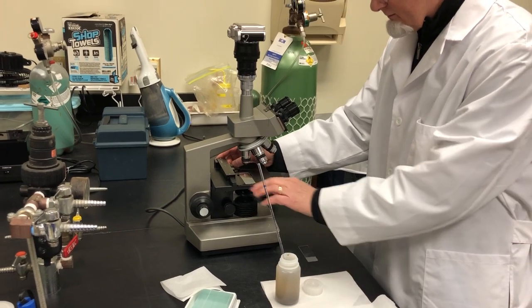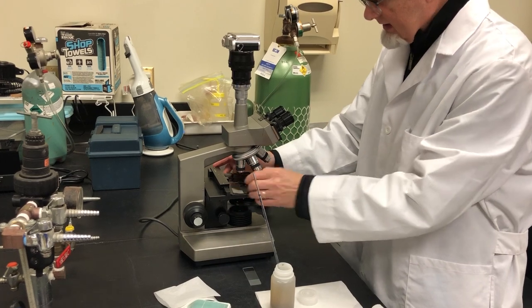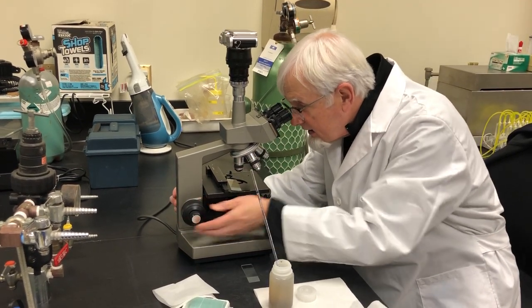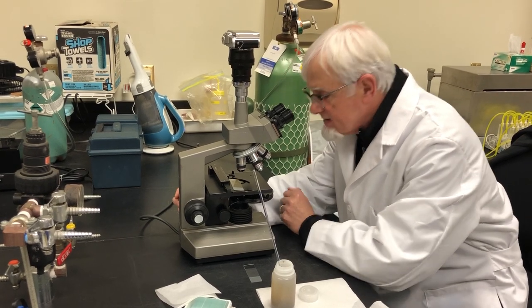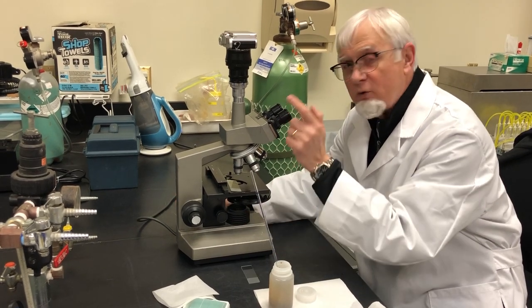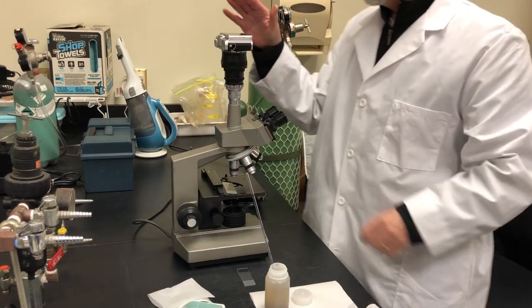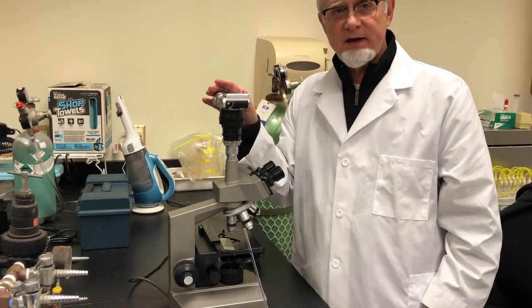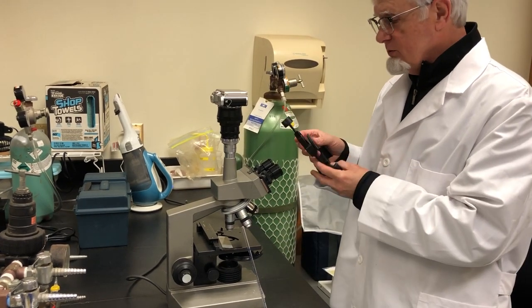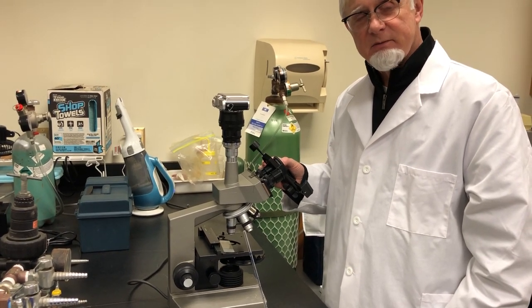Now what I'll do is I'll take that and put it under the microscope and go to 10x. I will view down there until I see some filaments and then I will switch my objective lens to 40x. This will give me a 400x magnification. I'll refocus, and if you have an electronic image capturing device you can capture your image from there, or you can use the cell phone adapter and attach it to your ocular here and capture an image that way.